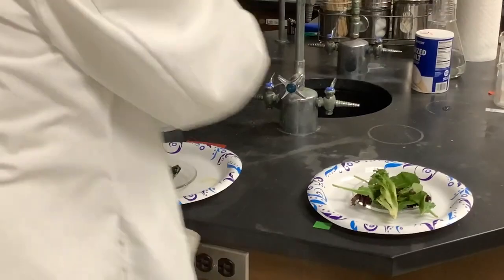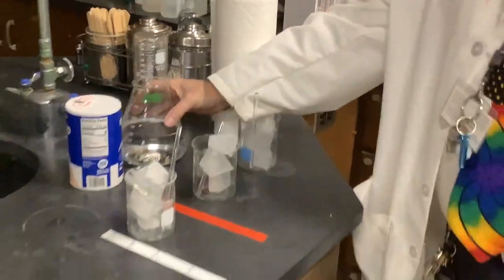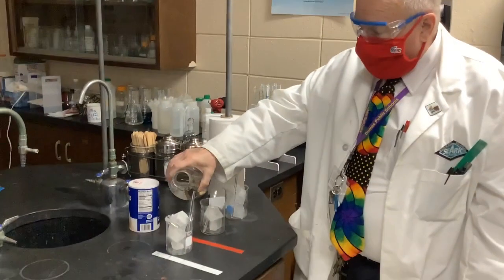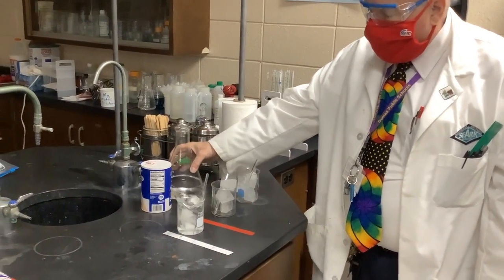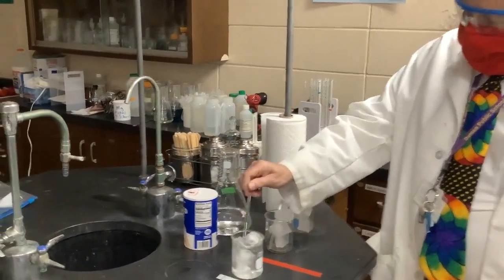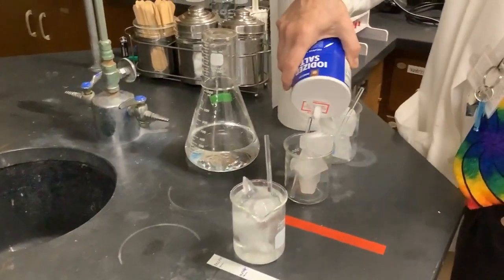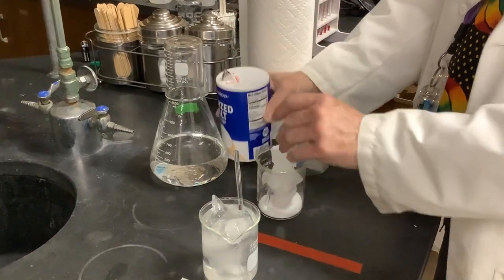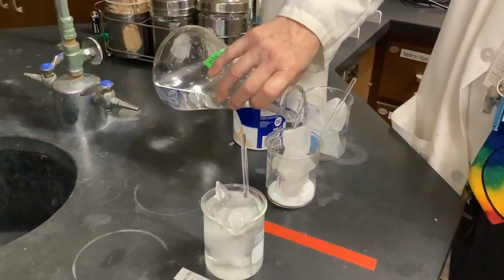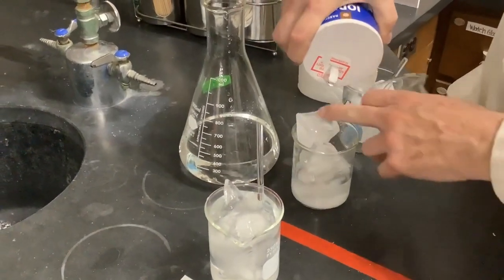Let me move these two density of ice beakers away and come over here for our third phenomenon dealing with ice, and that is, what kind of temperatures can we expect if we have ice in a polar environment? And by polar, I mean Arctic or Antarctic environment. So I'm pouring some water with some ice here, and then I'm going to add some salt to some ice here and get this ice good and coated with salt, and pour a little water on it, and then add a little bit more salt by way of adding salt to the system.